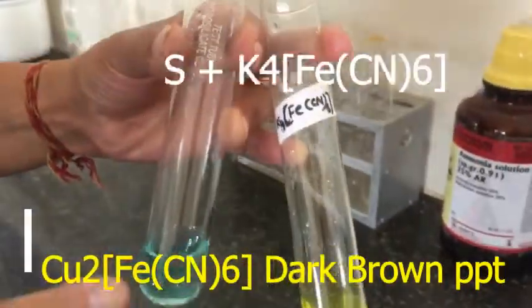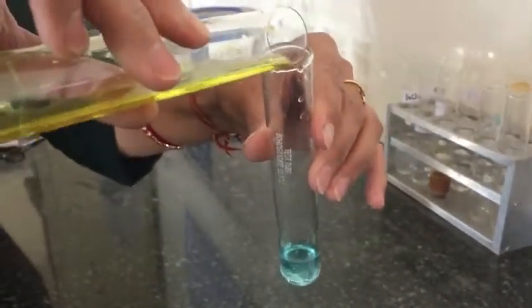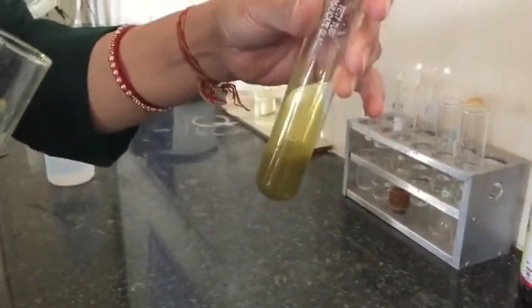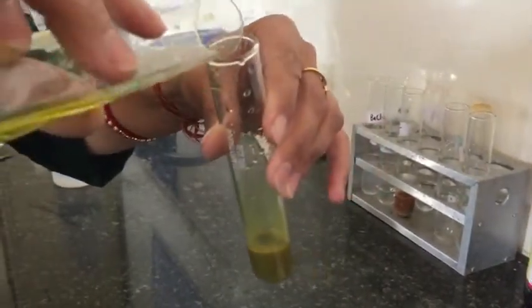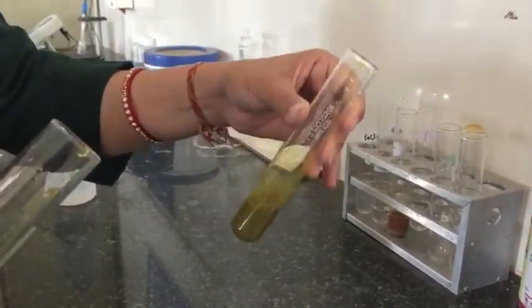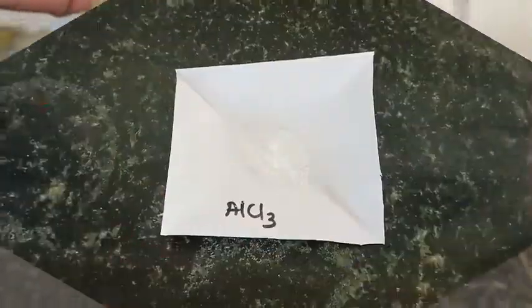To the third part, we are adding K4[Fe(CN)6] and it gives a chocolate brown color. Here you can see all three parts for comparison.